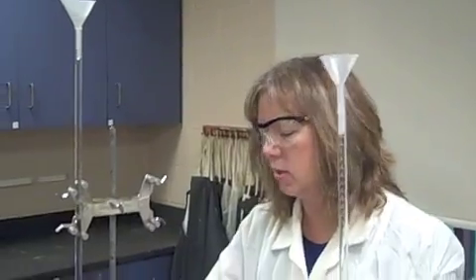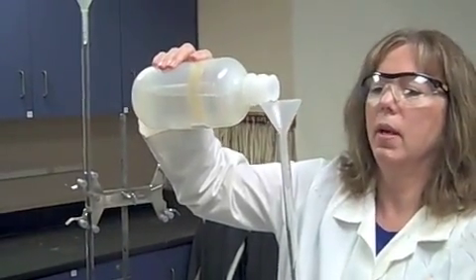Otherwise you can get them messed up, and that would cost you time, especially since this is a race. So now we're going to put the base into the burett, and we're going to do just a little bit and rinse.